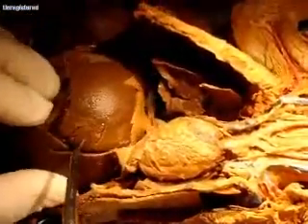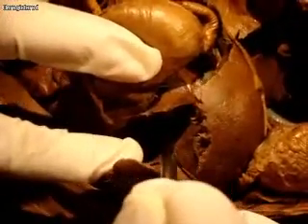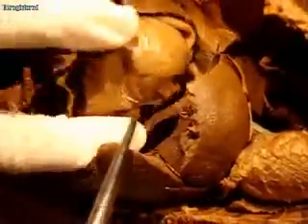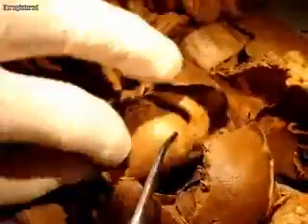And then we have the liver. You have the right lobe, right medial, and the left medial. And then you have the lateral lobe — so the right lateral lobes. And then sticking down, coming up, is that finger-like lobe that we call the caudate lobe. And then your stomach, with a couple of rugae — if you can get past the poop, there's rugae in there.